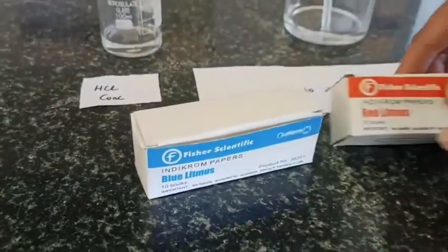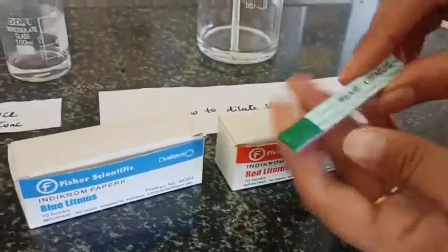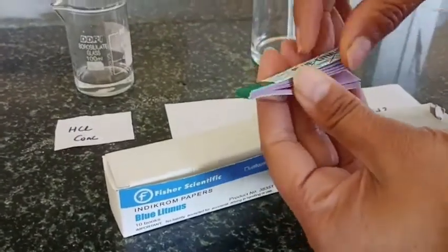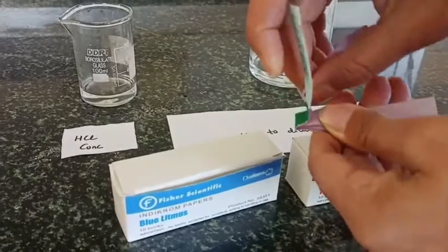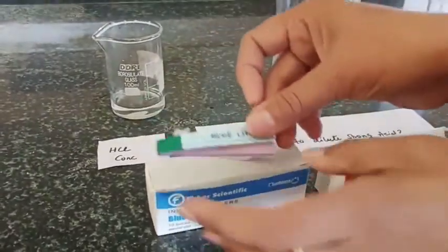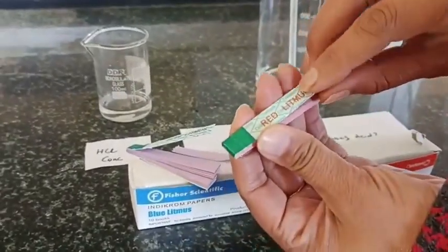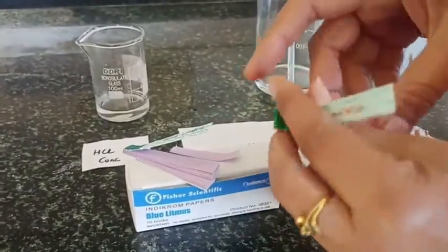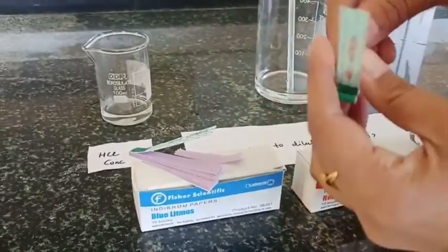Here we are using blue and red litmus papers. First, check how the blue and red litmus paper colors look. Here is the blue litmus paper — sometimes it is a little darker, but here it is very light. And this is how the red litmus looks.